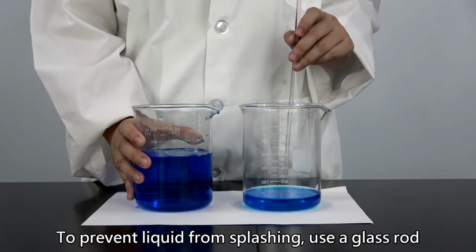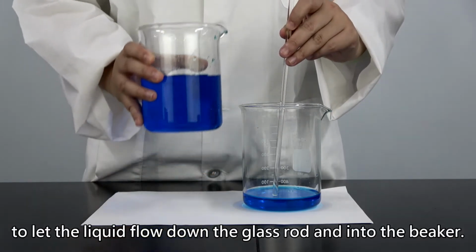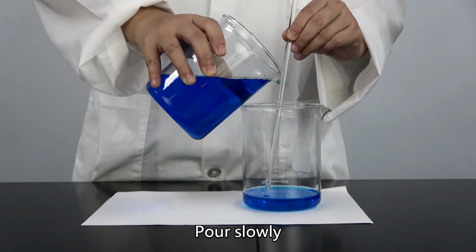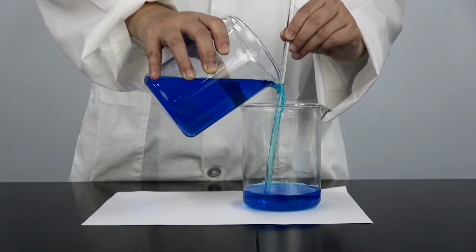To prevent liquid from splashing, use a glass rod to let the liquid flow down the glass rod and into the beaker. Pour slowly so the liquid would not splash.